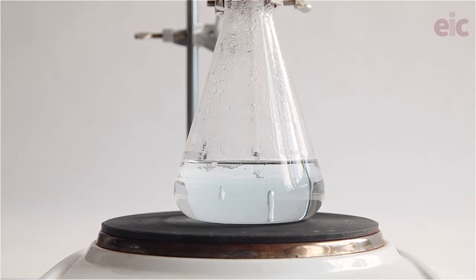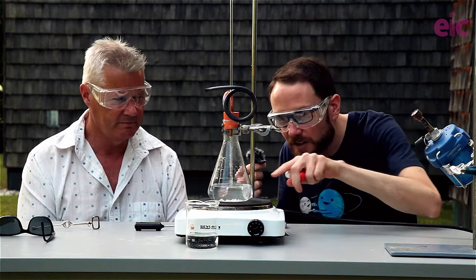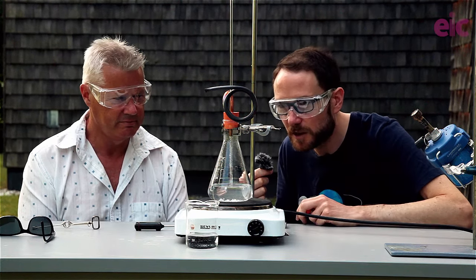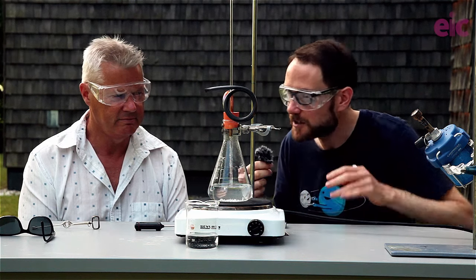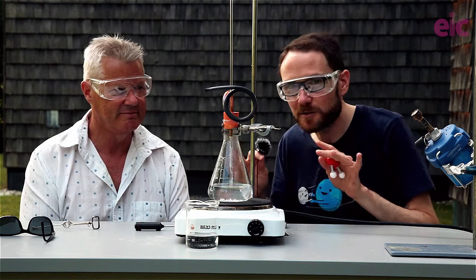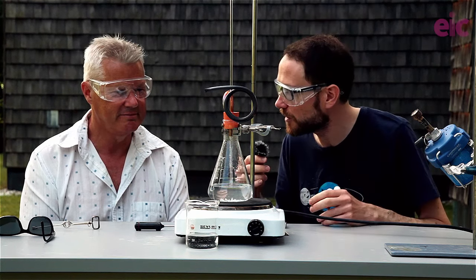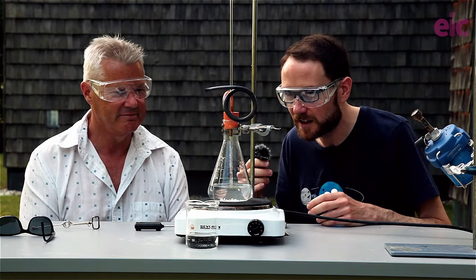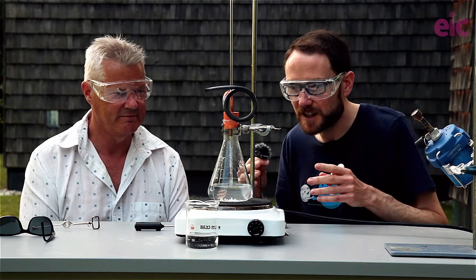Meanwhile, we're starting to get a little bit of action inside our tube here. And you'll notice that there's a few bubbles forming on our little boiling chips. They're beginning to hold up. And at this point, I think what we're going to do is just take a brief pause for a few seconds to do some magic of film. Fast forward until we get this onto a rolling boil so we can see what's happening next. So we'll just hit pause for a second and fast forward.